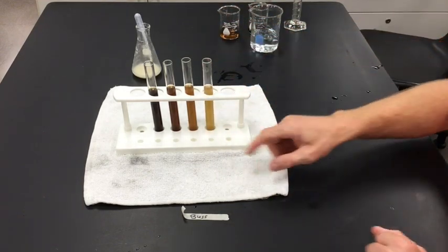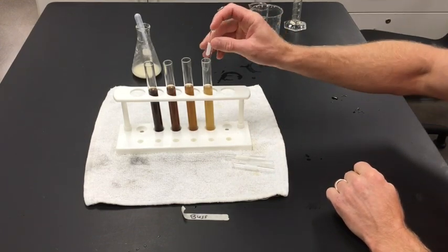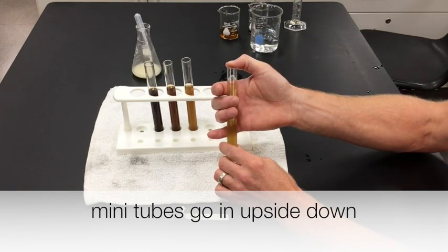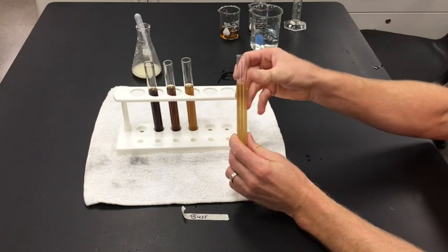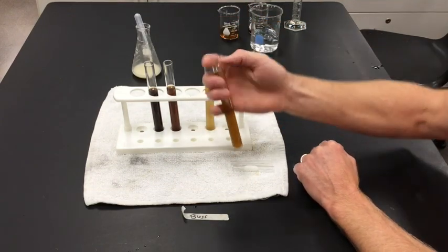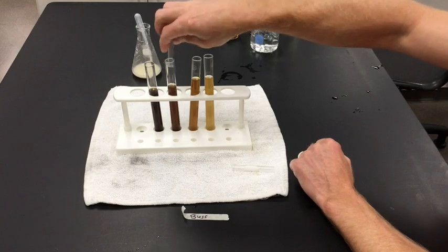The experiment is almost set — I need four miniature test tubes. Take a miniature test tube and put it in upside down; it's going to float because it's full of air. It's going to capture the carbon dioxide that the yeast are releasing, but it needs to start with liquid in it, so go upside down with it to fill it. Double-check that there aren't any air bubbles in there, then do the next one — put it in upside down and check for air bubbles. Do that for all four of them.